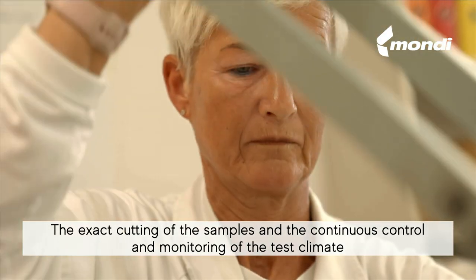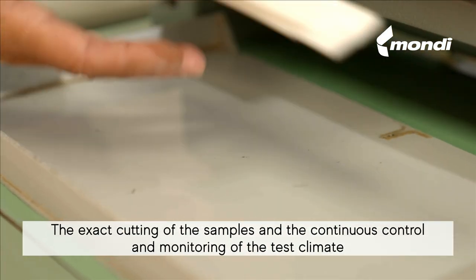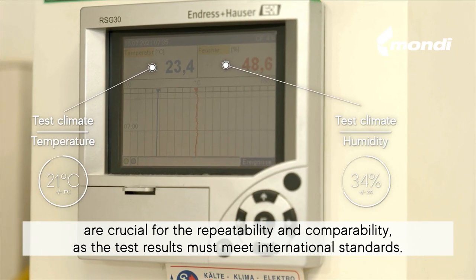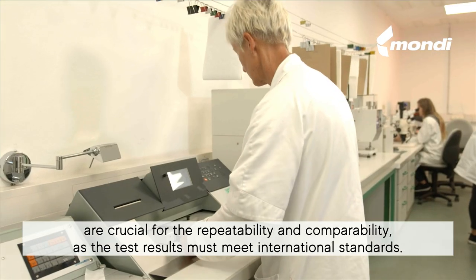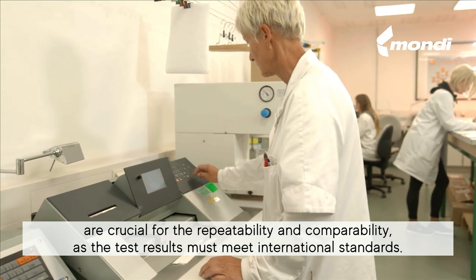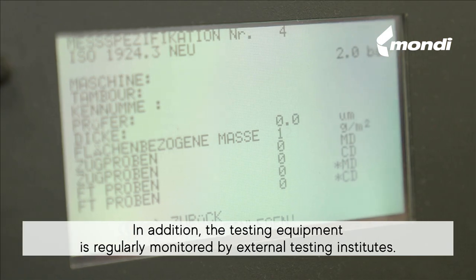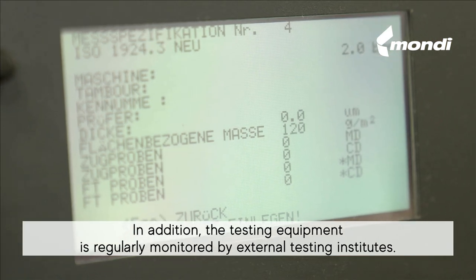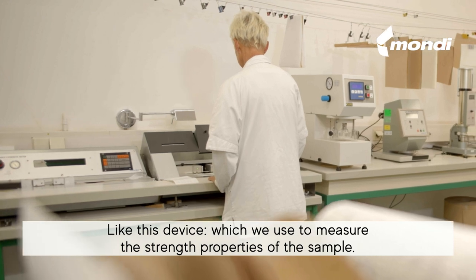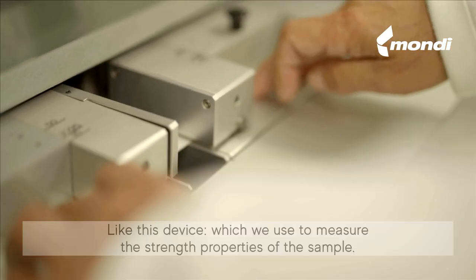The exact cutting of the samples and the continuous control and monitoring of the test climate are crucial for the repeatability and comparability, as the test results must meet international standards. In addition, the testing equipment is regularly monitored by external testing institutes — like this device, which we use to measure the strength properties of the sample.